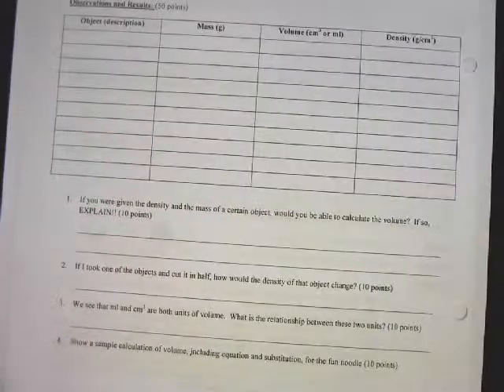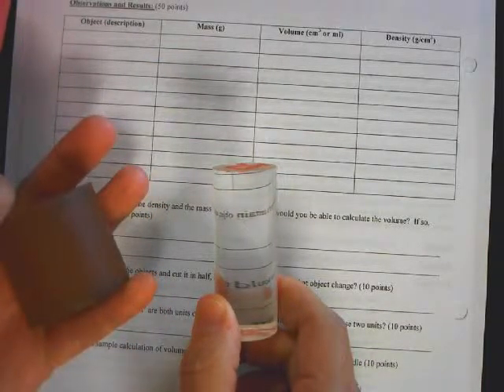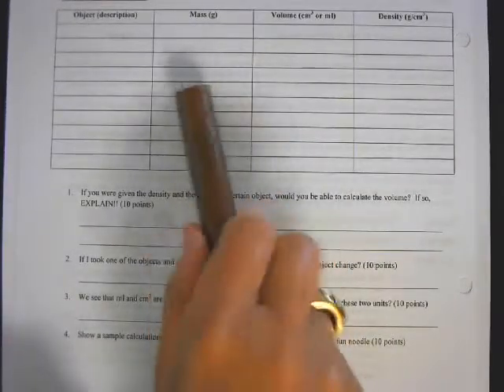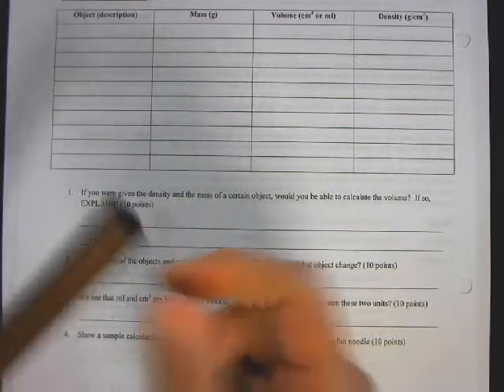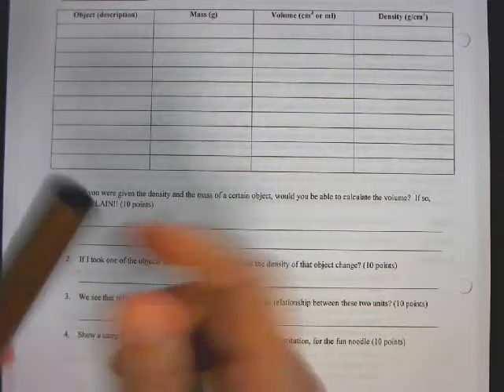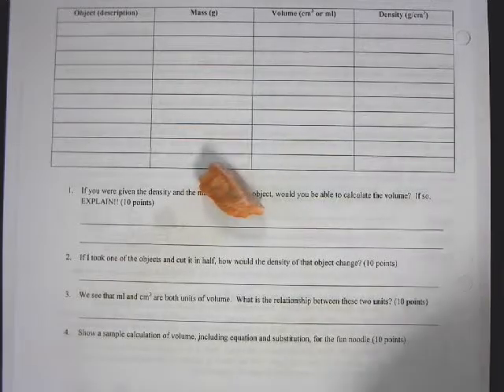Even though this one is a right cylinder, we'll also calculate with this one. So we have 3 using that equation. Now this one is a right cylinder, but it's hollow. We could do the inside and outside diameter, but since we're not using sophisticated things like a vernier caliper today, with this pipe only we'll use the same method we're going to use for the rock.